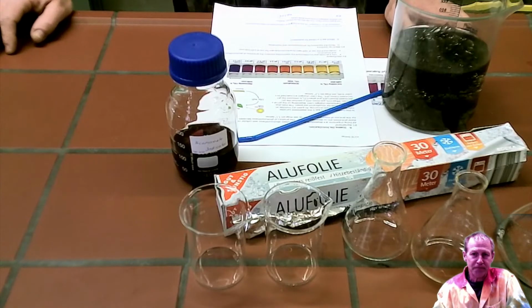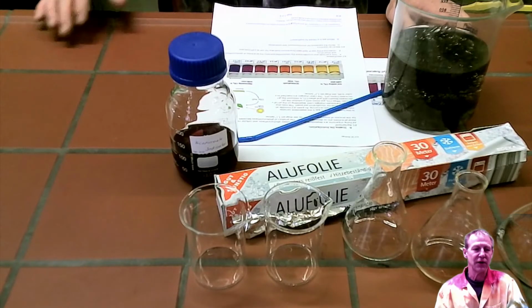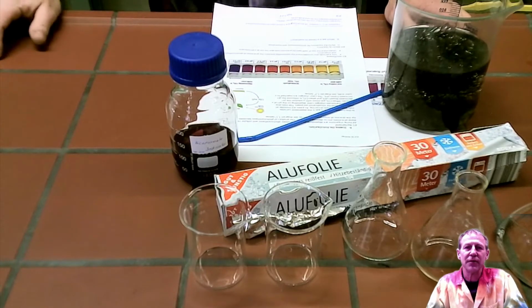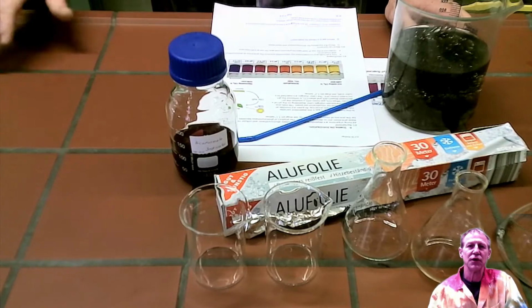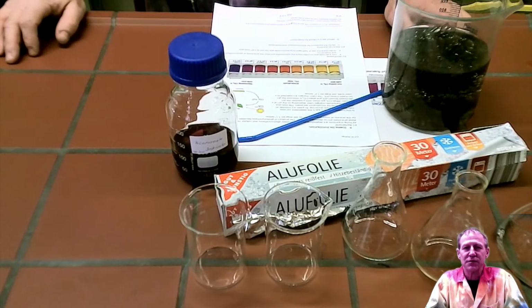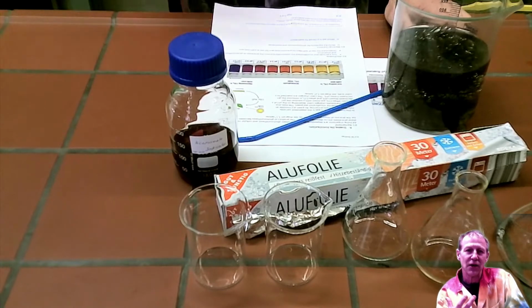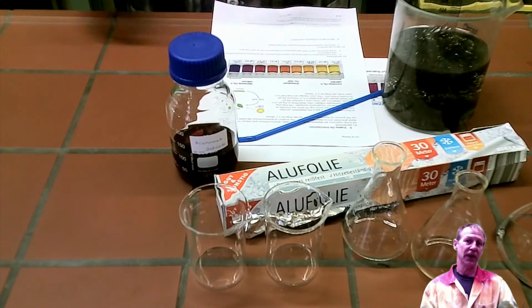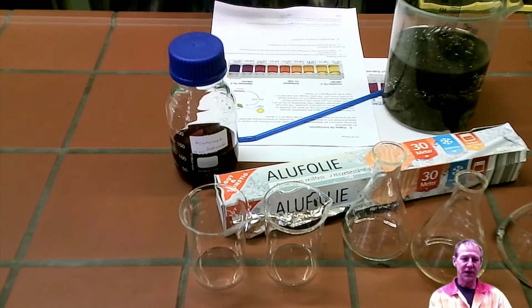Okay, so I'm going to go through an investigation here in a second, and there are two parts to the investigation. The first part is just setting up the experiment, and this first part will show you cellular respiration and the fact that humans, organisms, or living animals can exhale or secrete carbon dioxide as a waste product. Okay, so I'll go through the equipment here in front.